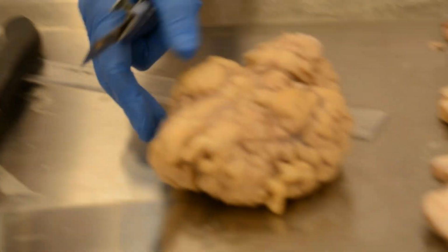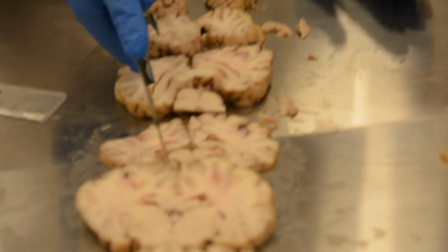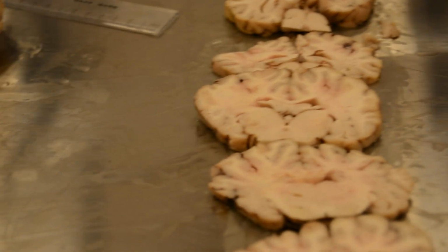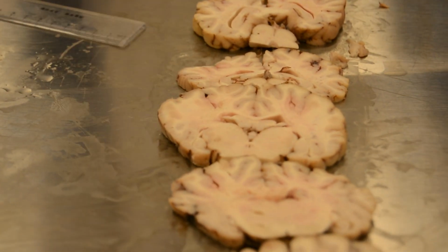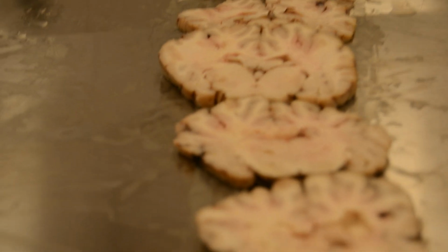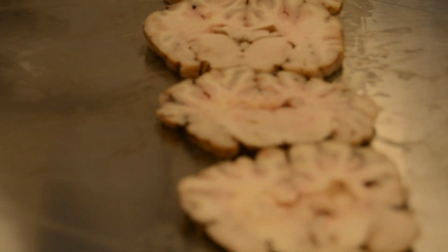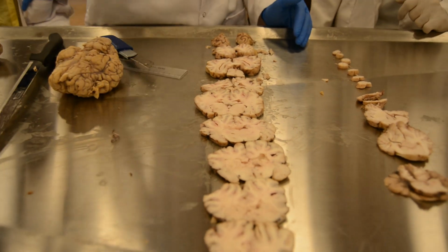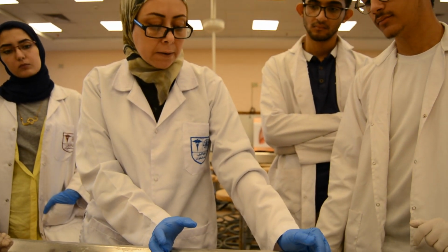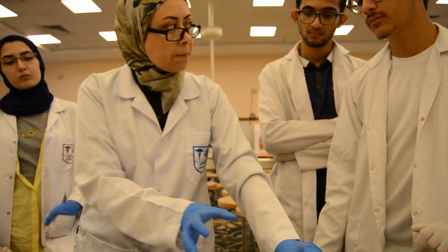The first is from watershed area 1. This is watershed area 1, all of this. But at the level of the mammillary body, I can take 1 and 2, because the internal carotid system supplies the anterior 2/3 of the brain, and the posterior cerebral vessels from the basilar system supply the posterior.